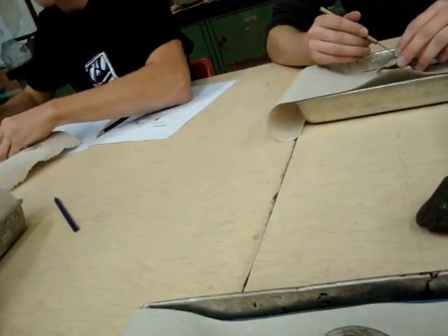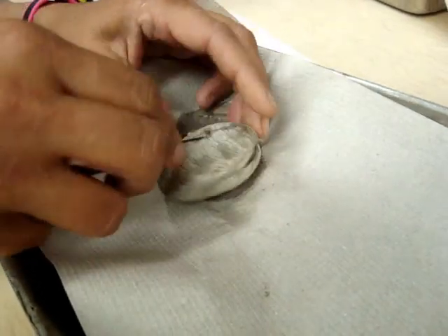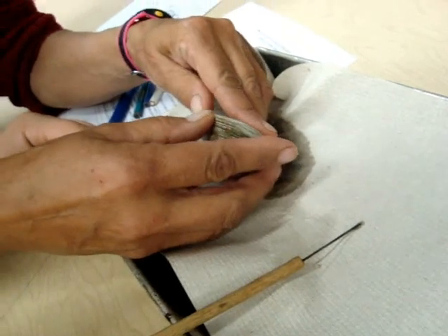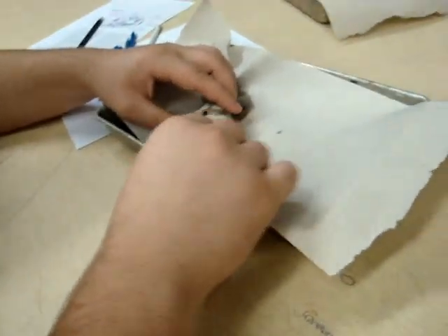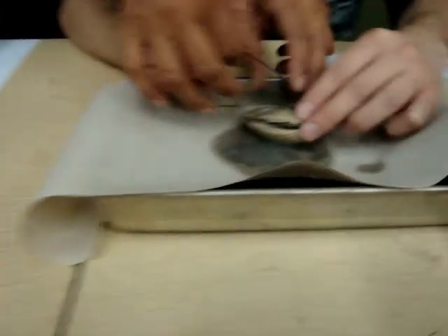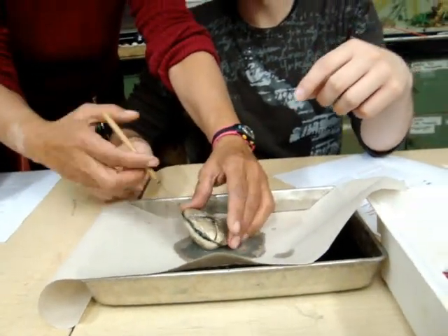That probably shouldn't have gone right in the middle. So if you go like this you might be able to... So you want to scrape the adductor muscle loose, and then you might be able to open it. I have no idea what's going on. Nick has it easy. This has never happened before. Yeah, it's a straight hole. I just broke the poor clam. Let me see — I killed him. No, that's perfect. Because see, you didn't break the bottom. Now go like this. Maybe we should get the goggles out.